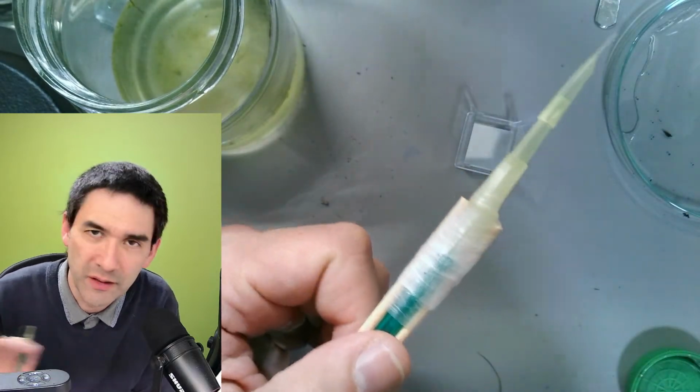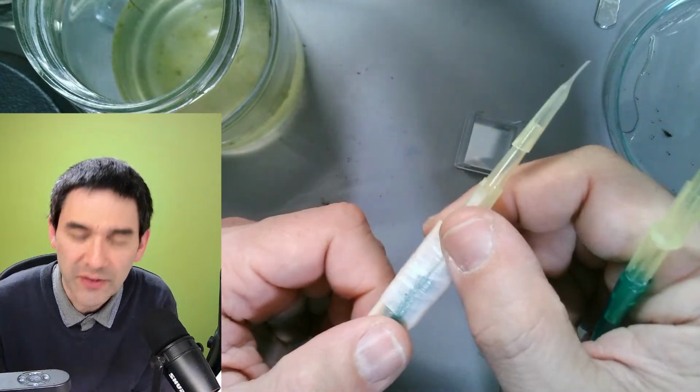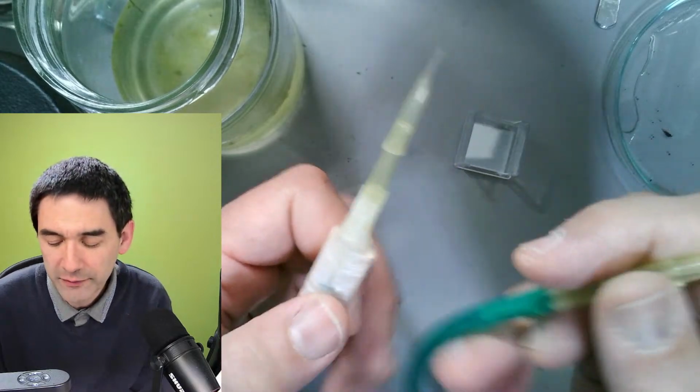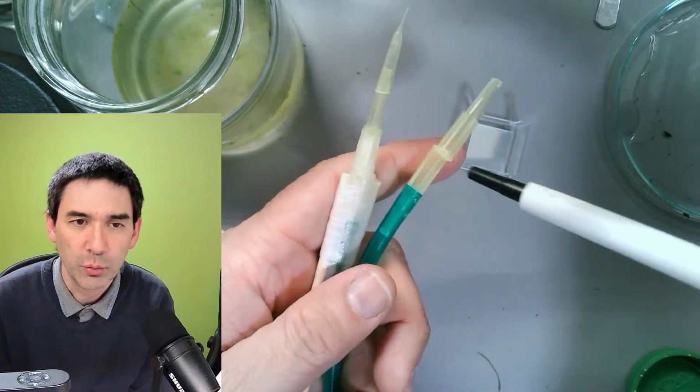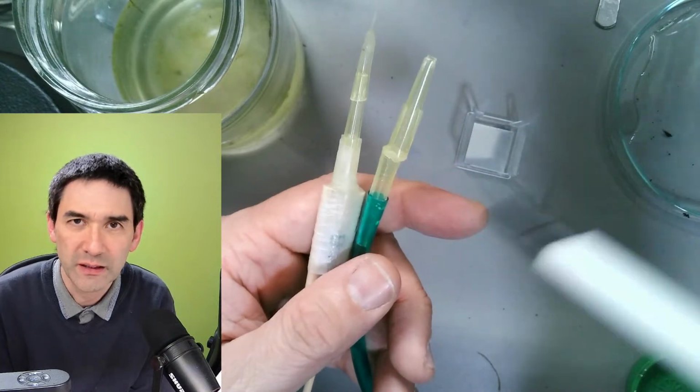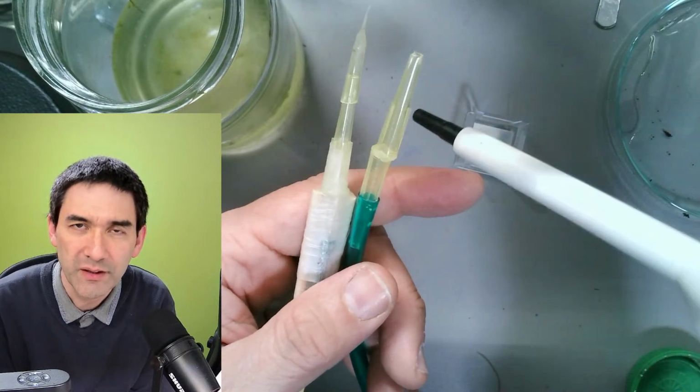primarily in order to remove all of the debris and all of the unnecessary things that you do not want to have in the picture, right? What I have done in the past very often is, for individual water bears, I simply picked it up with a pipette and then transferred it. But this also takes a very calm hand.